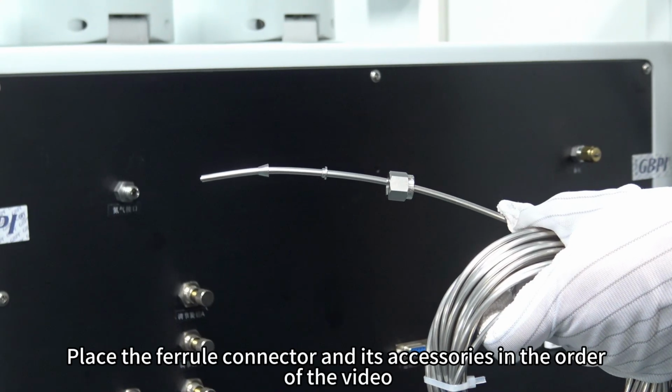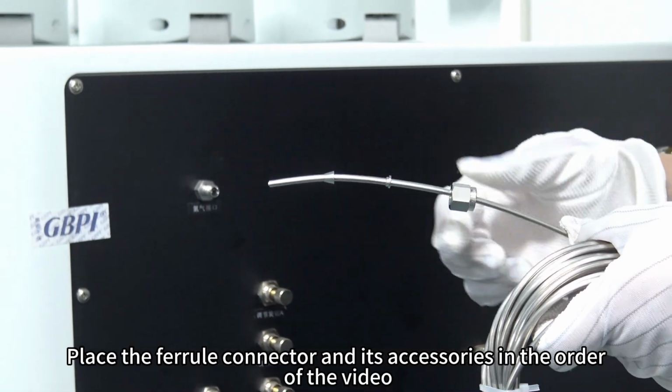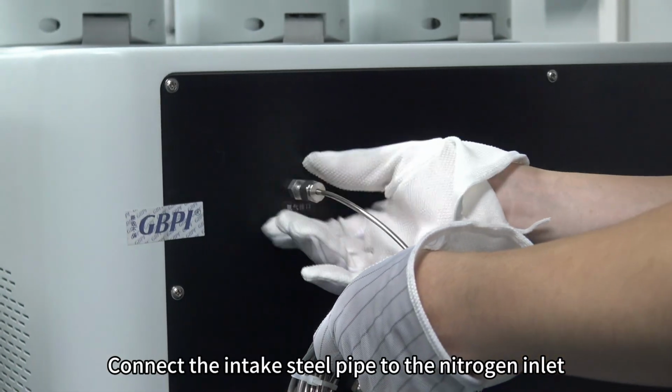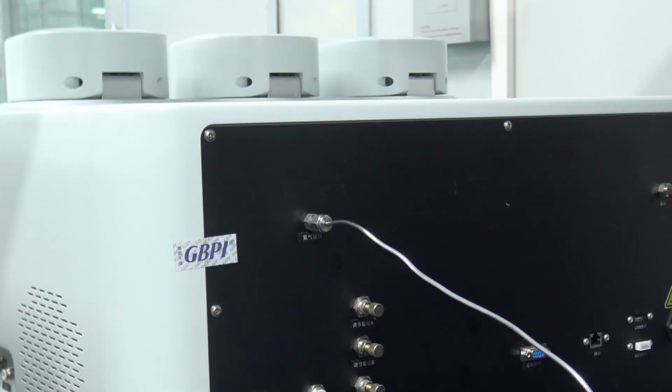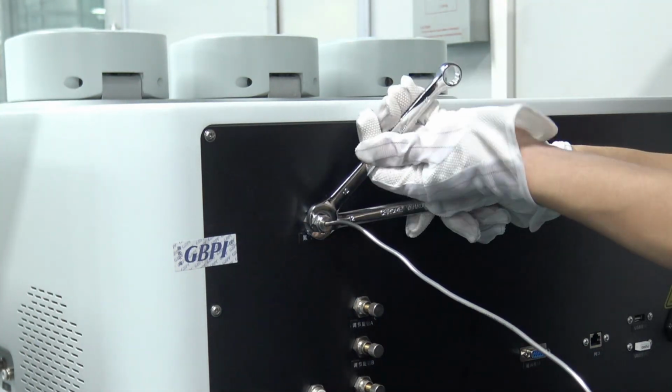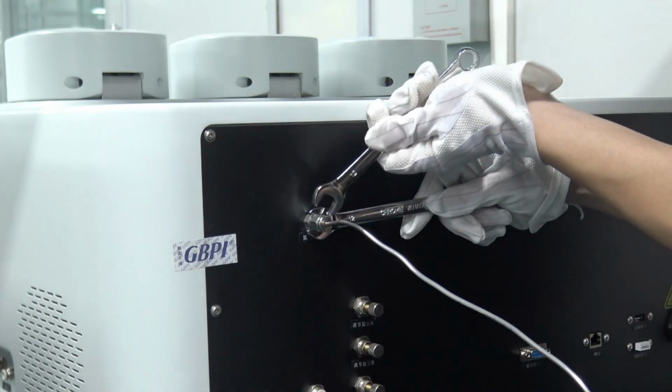Place the ferrule connector and its accessories in the order of the video. Use the ferrule connector to connect the intake steel pipe to the nitrogen inlet. Lock the nut with a wrench. Tighten clockwise.